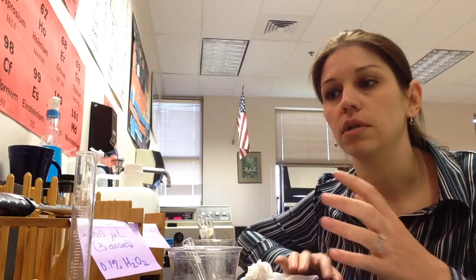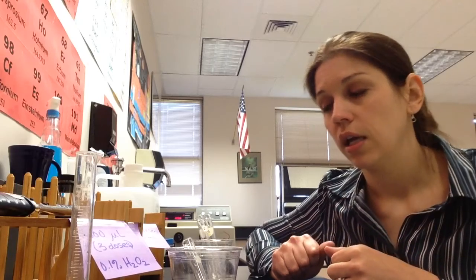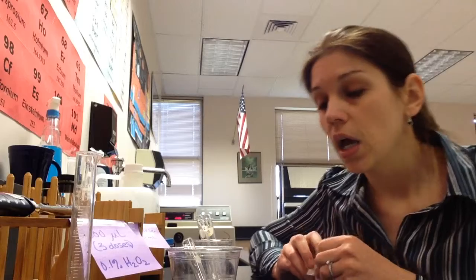So now we're actually ready to generate data, and remember the purpose of this whole lab is for you to learn how to generate data. There's not as much data analysis as there is with the DISC lab. This is about how do you use a spectrophotometer and how do you use all this equipment, so that if you do want to use this kind of stuff in order to do your inquiry project that you'll do later on in the unit, you have the proper techniques in order to do so.